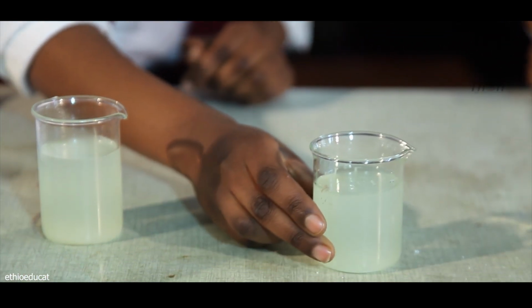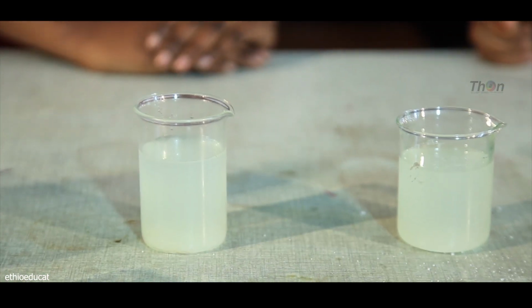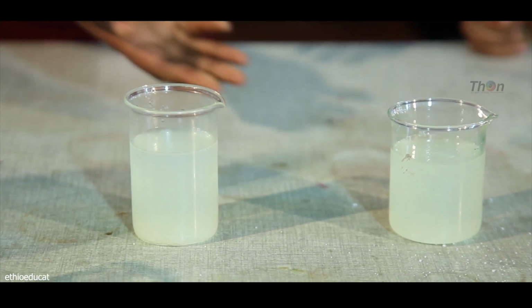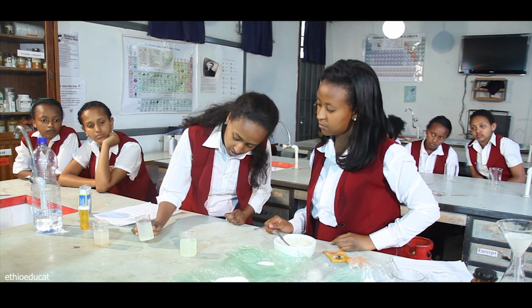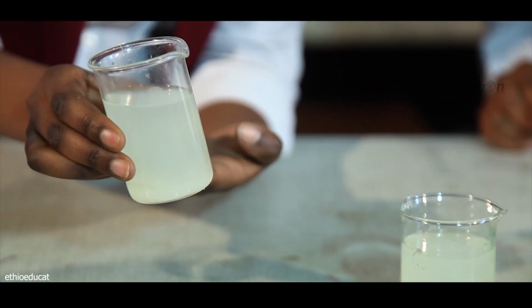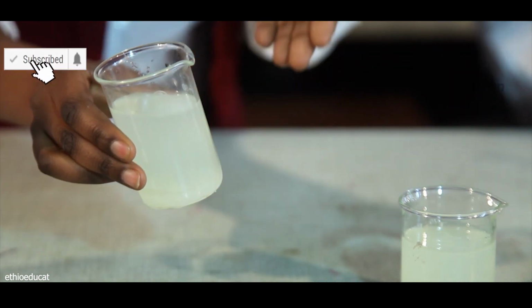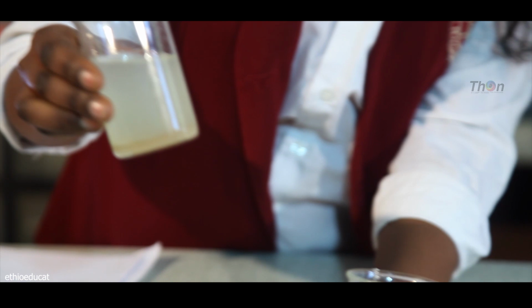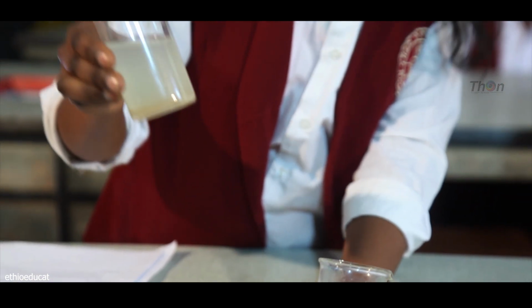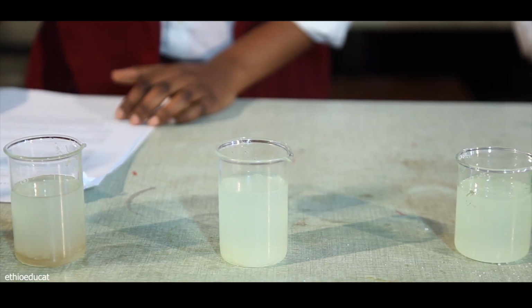So, what difference do you see between the 2 beakers? I think in your beaker you have stirred the solution, so the sugar has almost completely dissolved. And in my beaker, I didn't stir the sugar, and still there's a suspension, which I mentioned before, because I haven't stirred sugar, and it has characteristics of suspension, but it's still dissolving. And the third one, compared to this, it has dissolved, but there's still suspension. Yes, which has similar characteristics. Yes. Suspension.